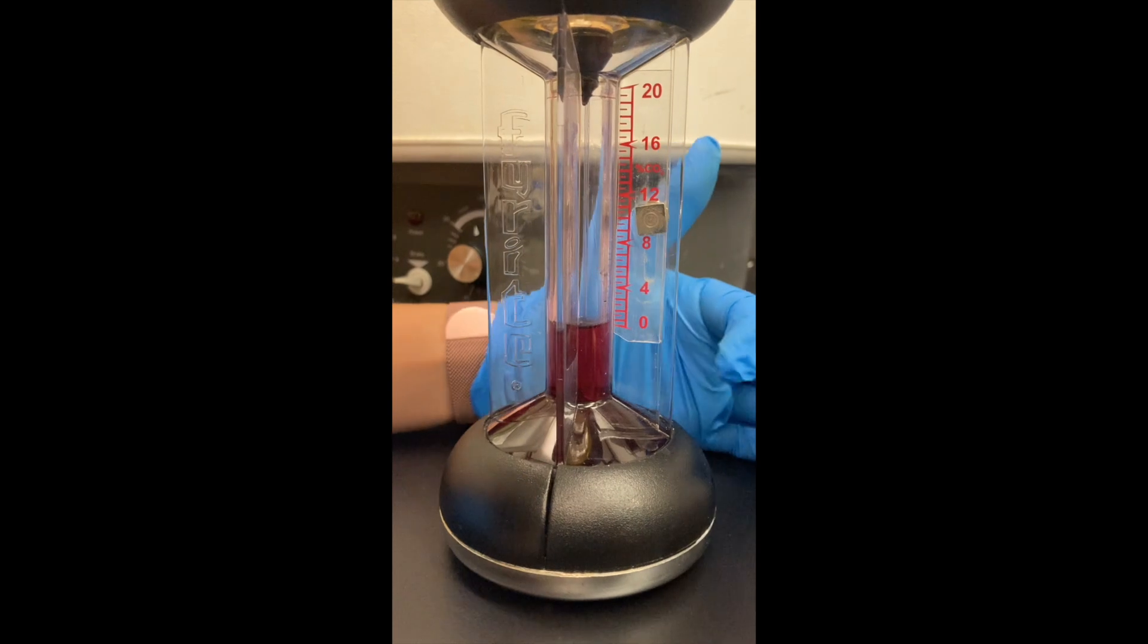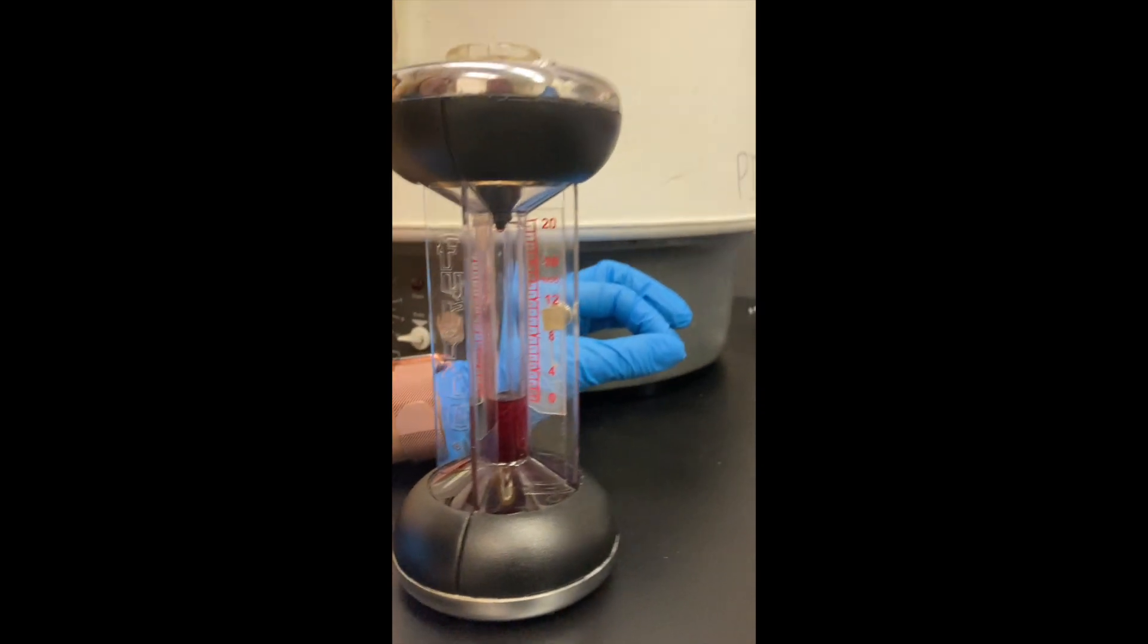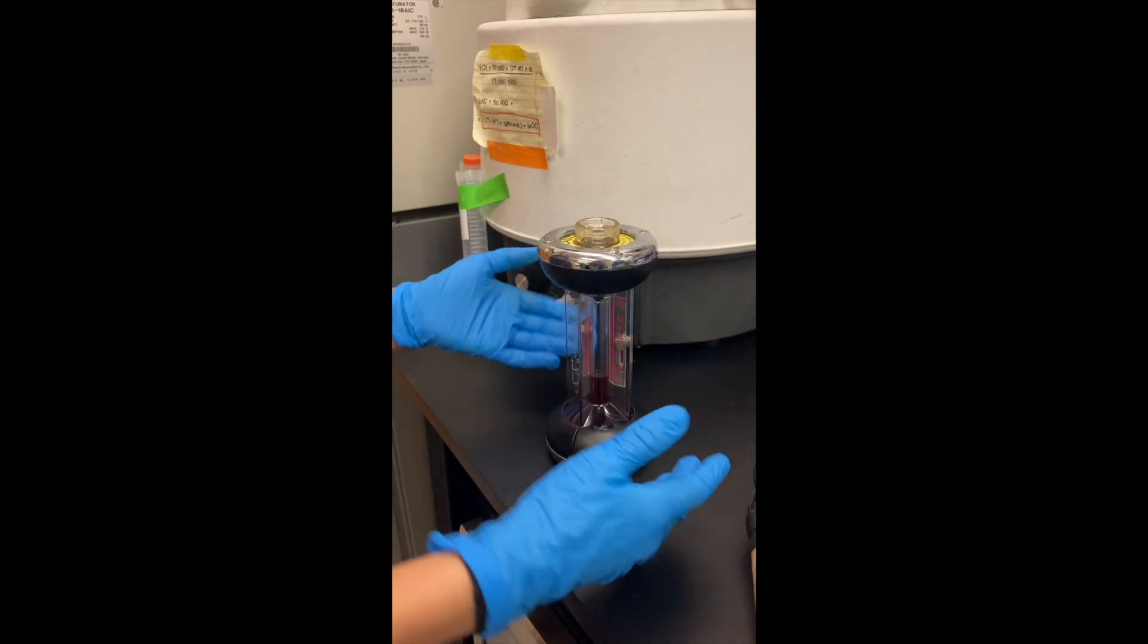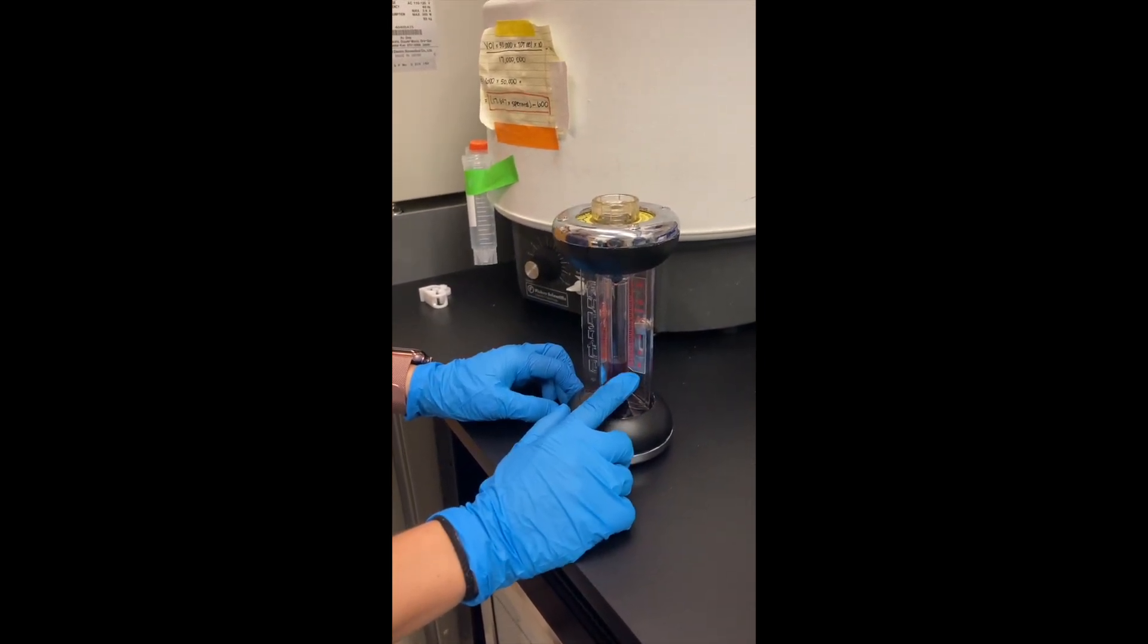This liquid is right here on zero, the mark zero. So first thing, we gotta measure just the CO2 that it's in the air, so we can make sure whatever it goes, we put it as zero here.